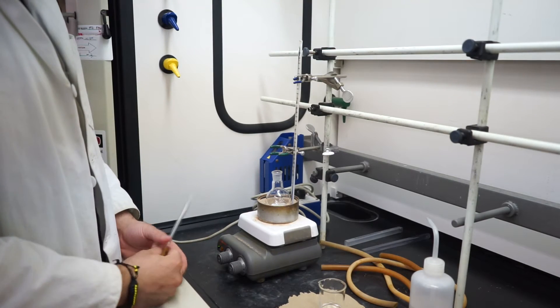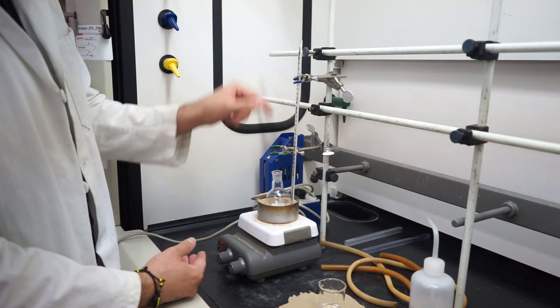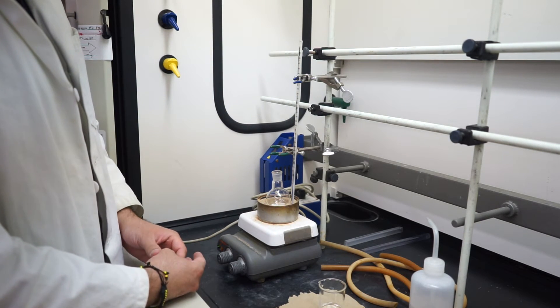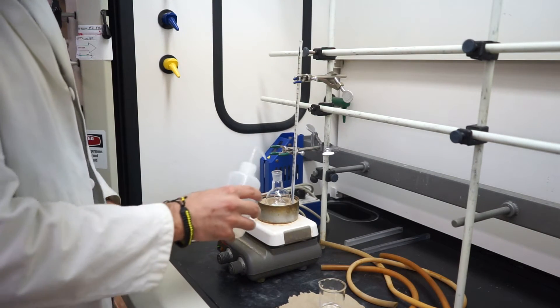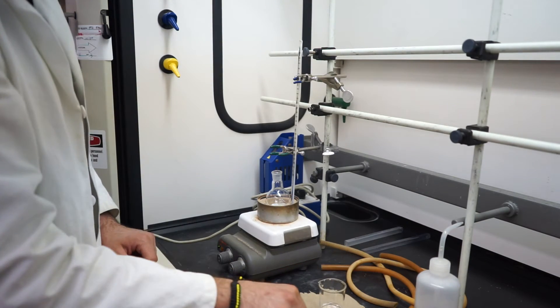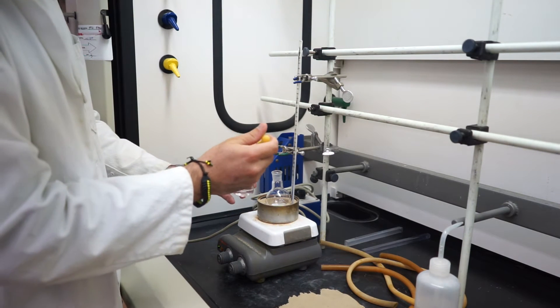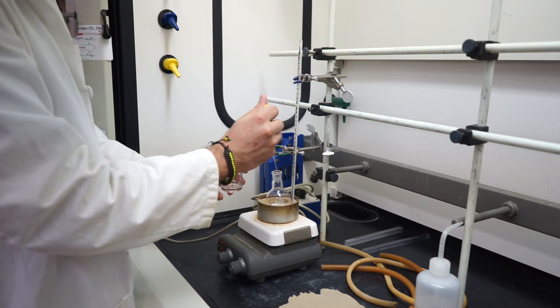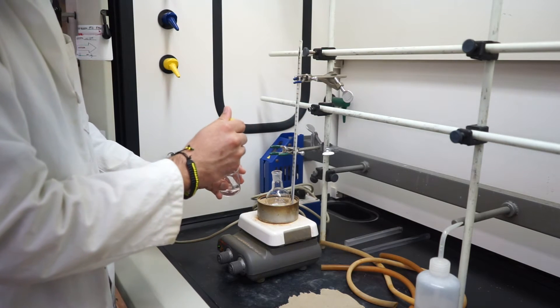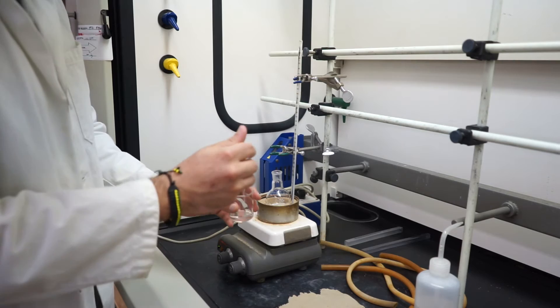Let's take a look at our reaction setup. First we have a round-bottom flask. I already have my thermometer in my sand bath, clamped up to make sure it doesn't fall over. We're going to put all the reagents in. I'm going to simulate what we're going to have — a little bit of an aqueous phase, so I'll put some DI water in there. We're also going to have some diethyl ether, which counts as our organic phase. We're just simulating a two-phase system, so we'll add our second phase and now we have two phases in our reaction mixture.